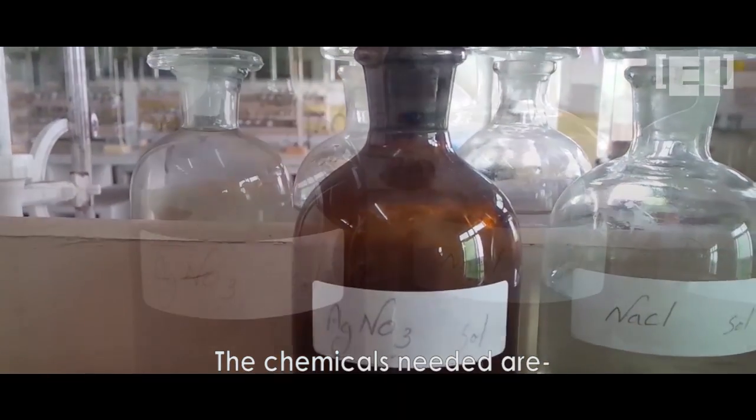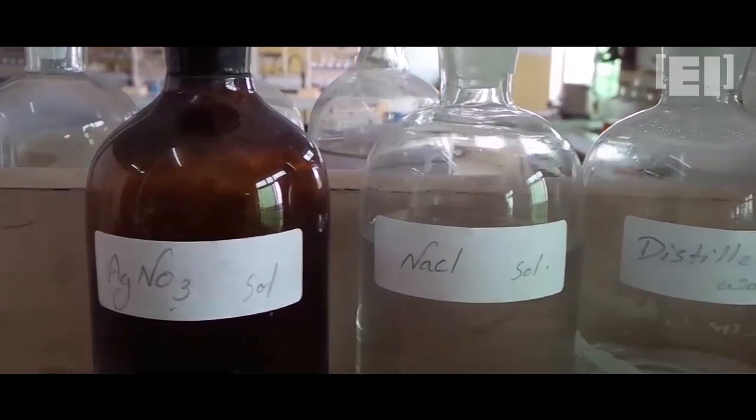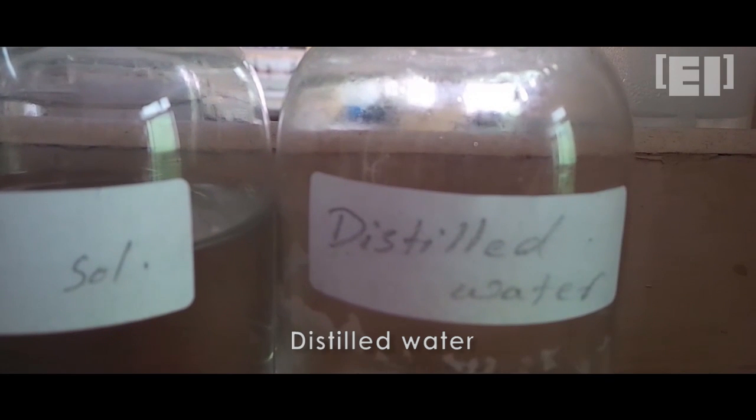The chemicals needed are N/50 AgNO3 solution, distilled water, and freshly prepared potassium chromate solution.